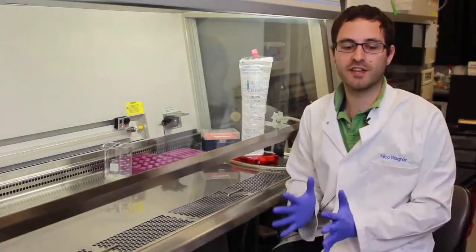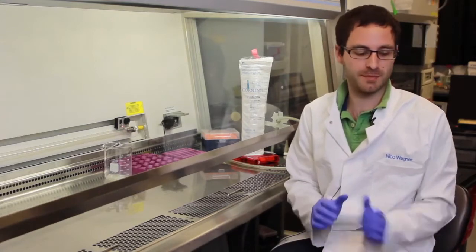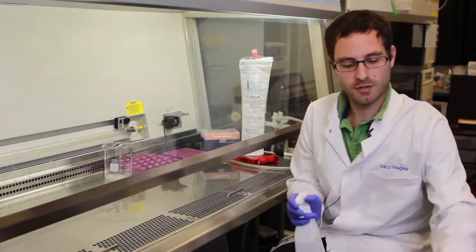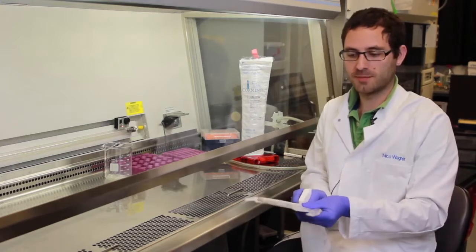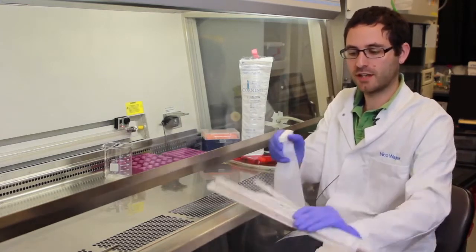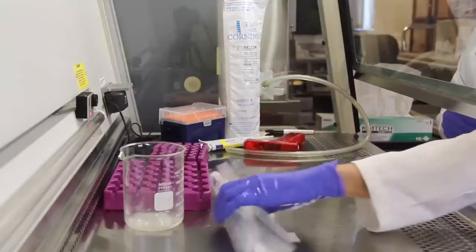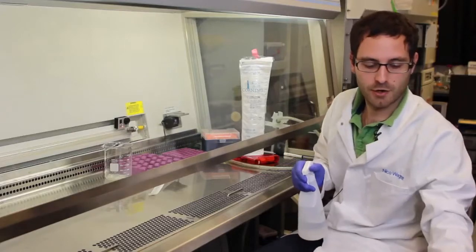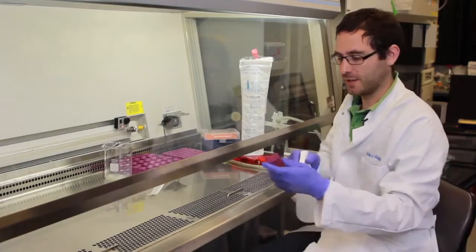Similarly, everything I will need inside the hood also needs to be sprayed down with ethanol. So all of my various serological pipettes that I'll be using I'm spraying down, and all of the reagents I'll be using I'll be spraying down.